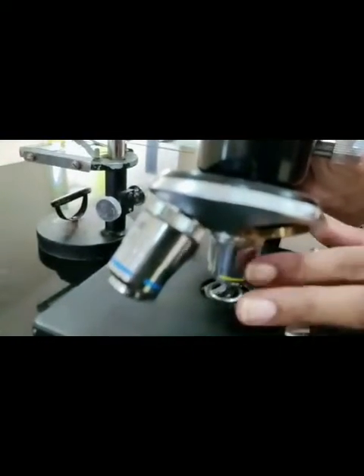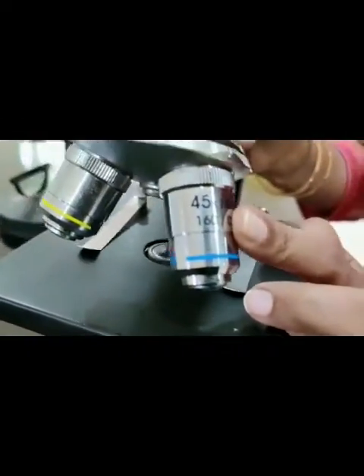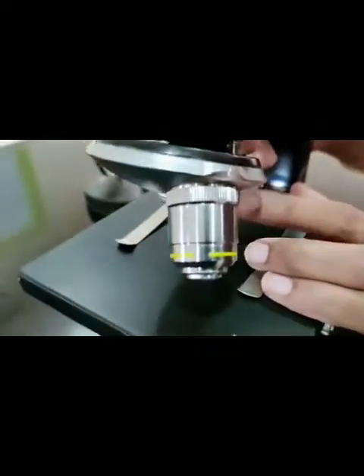Then we have this tube structure where the lenses are attached. Here we have one lens at the top, and at the bottom we have the lenses arranged on the nose — the nosepiece — where the different magnifying lenses are fitted. We can also attach a high-power lens or the 100x lens. These are called the objective lenses.